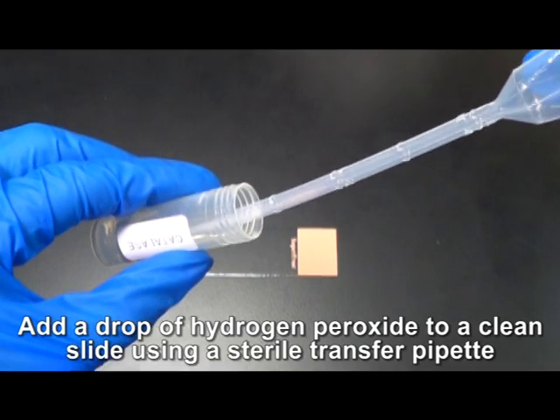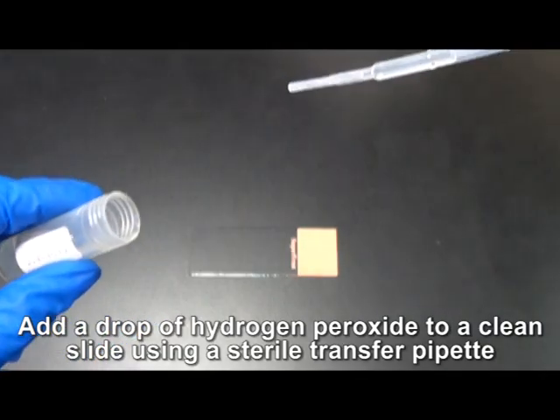To perform the test, add a drop of hydrogen peroxide to a clean slide.